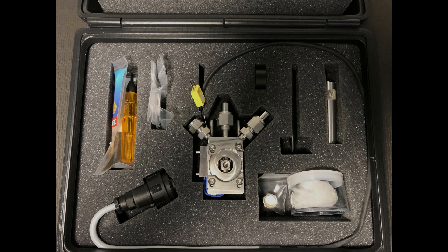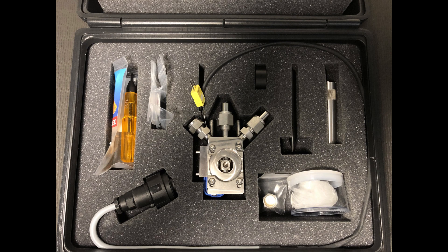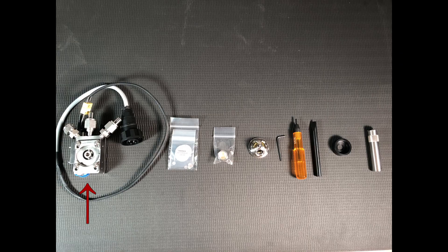When you receive your High Temperature Reaction Chamber, you will also receive the following items: a High Temperature Reaction Chamber, also known as an HVC; a screen set with two each of three mesh sizes; a gas port cover; an HVC dome; a 5/64-inch hex L wrench; a 3/32-inch hex wrench with a handle; a packing tool; an overflow tray; and a window wrench.